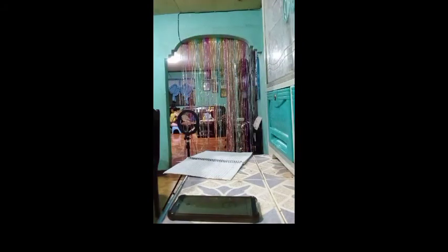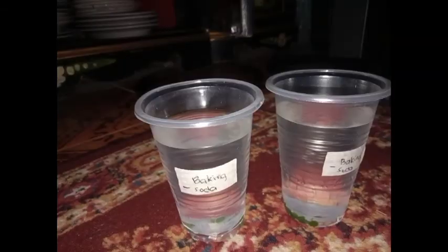Place the negative baking soda cups into a dark area like a shoebox, closet, or drawer. And then in the dark environment, it didn't have any of the leaf discs floating.